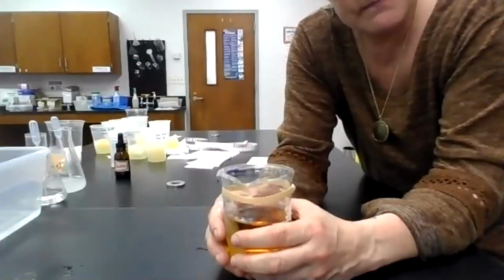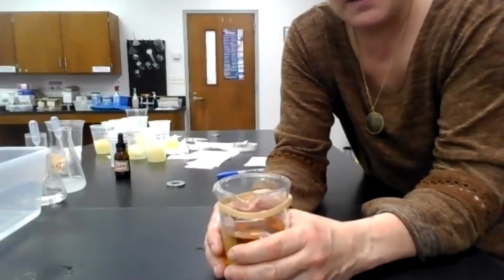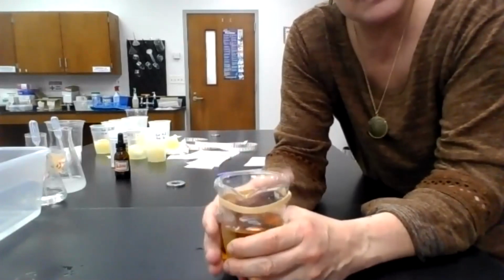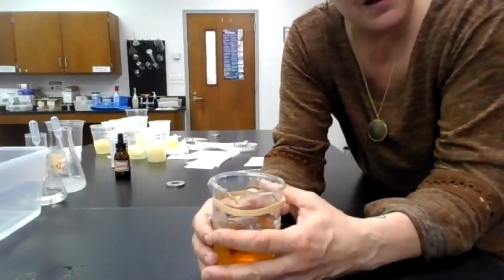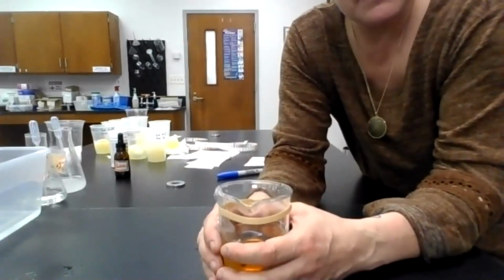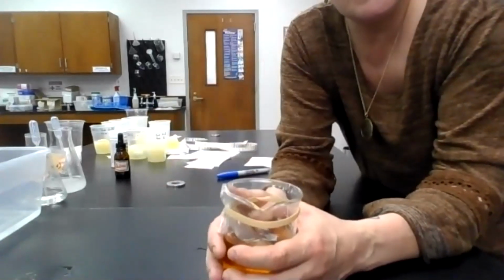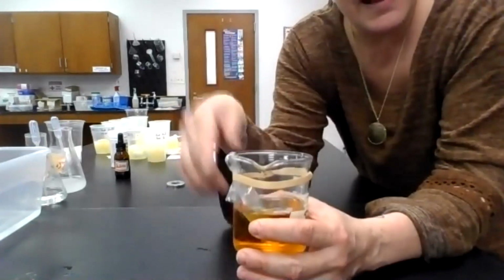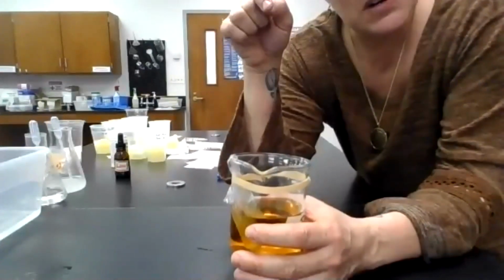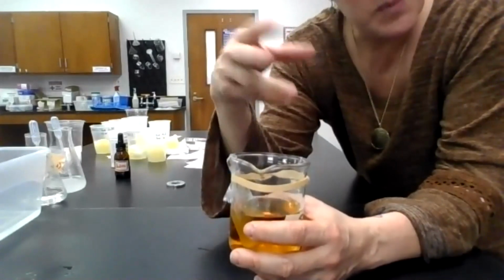So inside the bag is starch and glucose, a very high concentration of both of them. The beaker water is just plain water. So compared to the contents of the bag, the water is hypotonic. Now, the principle of diffusion is that particles like glucose and starch want to diffuse with their concentration gradient from where they're in high concentration, like inside this bag, to where there is low concentration on the other side of the membrane, which would be the tap water with iodine. That would be a lower concentration.